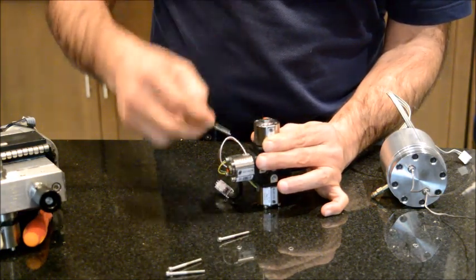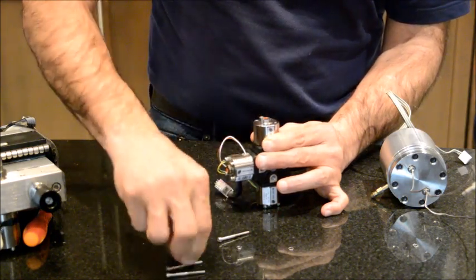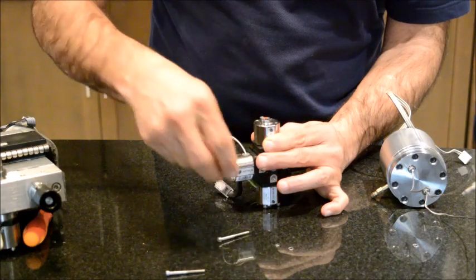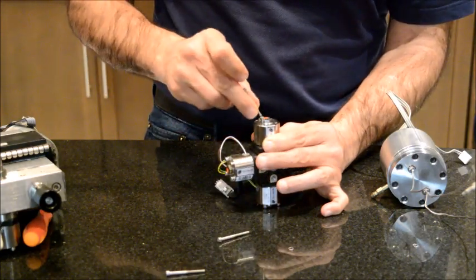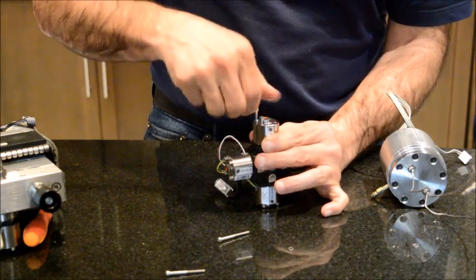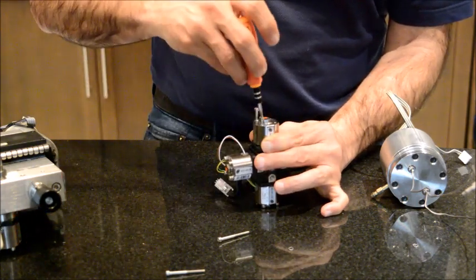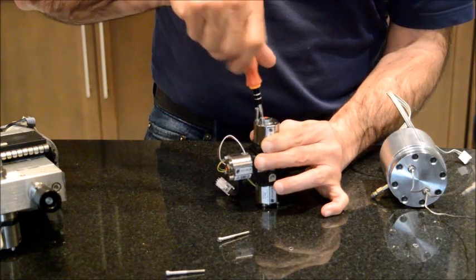I will use this washer. These parts are very small and they're not easy to grab. I will screw one. As soon as I screw one of them, it would be easier to hold on to the rest of them.